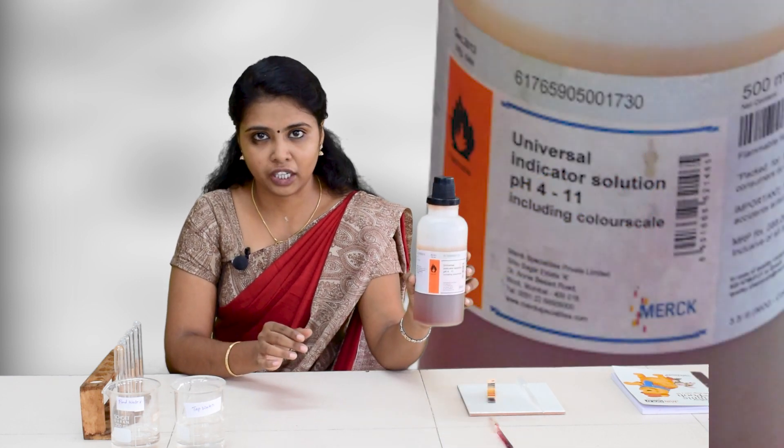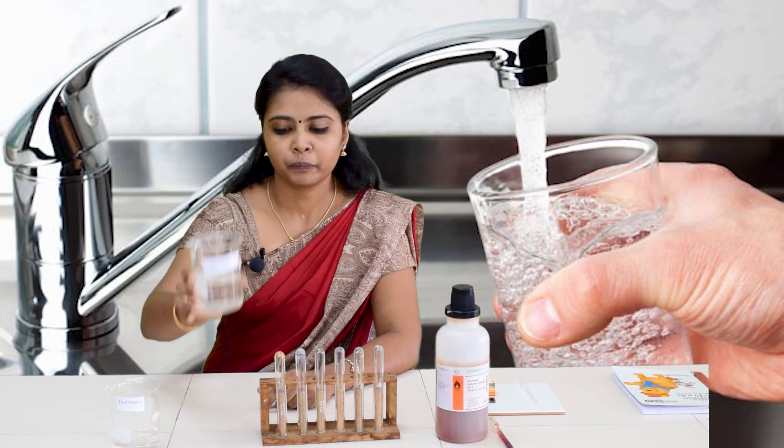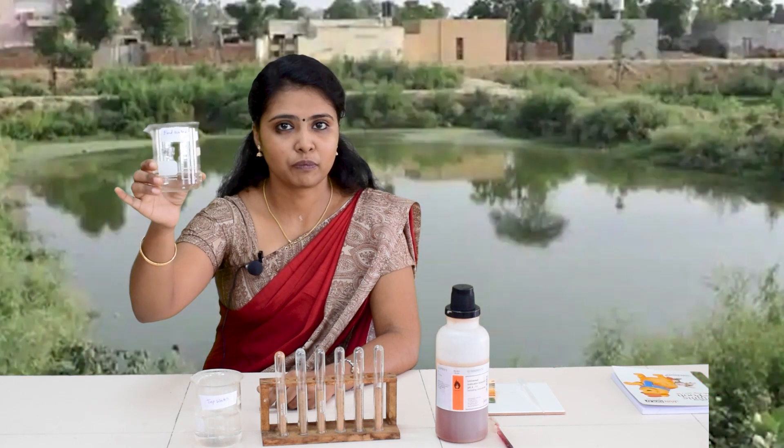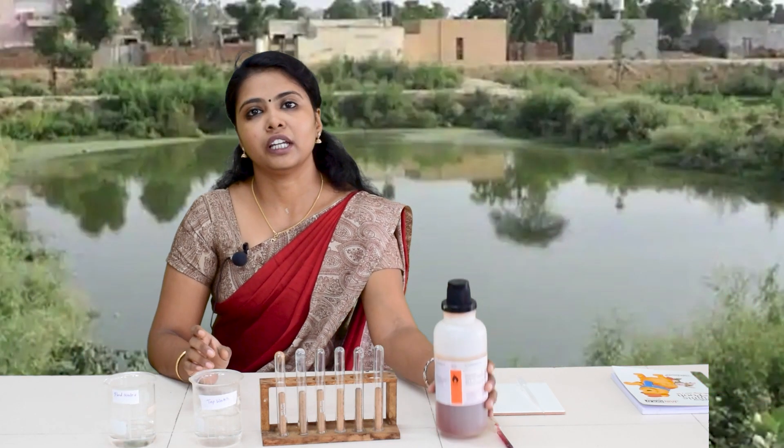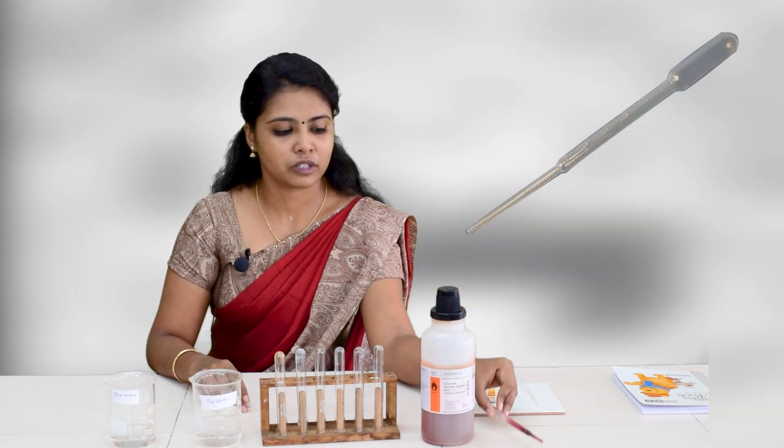Today, we are going to identify the pH of different water samples. This experiment can be conducted in 2 ways — using a pH paper, or using the universal pH indicator. For the first method, we need a test tube and test tube stand, water samples — this is tap water and this is pond water — the universal pH indicator, and a dropper.